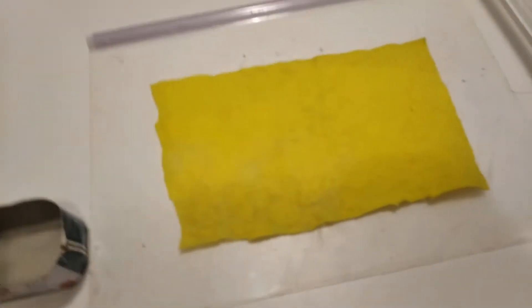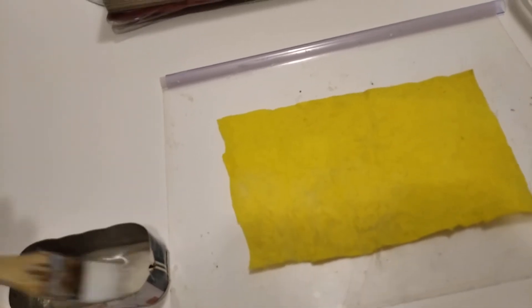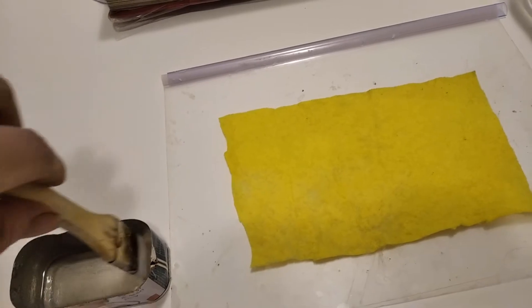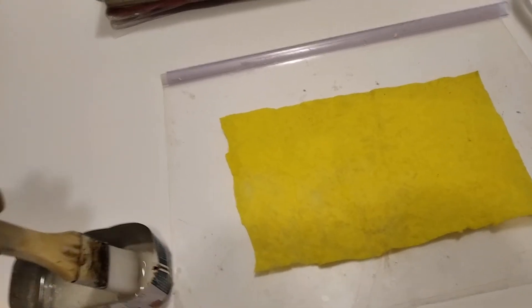What you want to do now is start painting it. You notice this glue no longer feels like the same glue — it's a thinner syrup, which is kind of what you want. Just evenly mix it so that the citric acid is evenly distributed. Just like the previous membrane, it's painted on. Unlike the previous membrane, it's not as easy to repair this if it breaks in the cell, which is why I still think borate is better. If you're not doing any real runtime calculations, you're better off using borate.